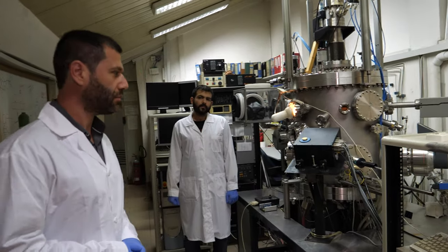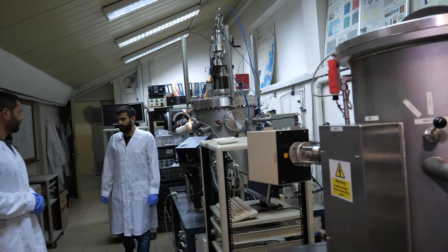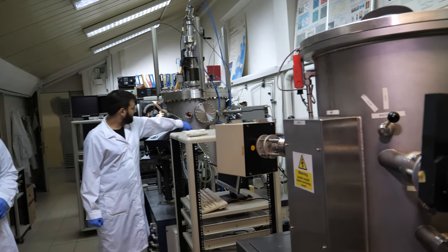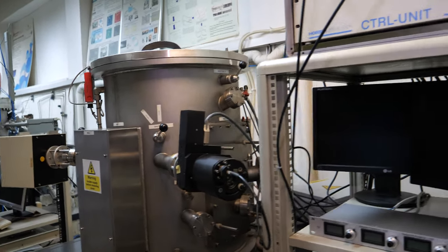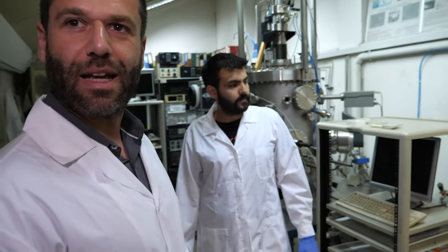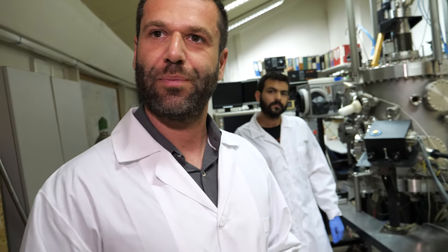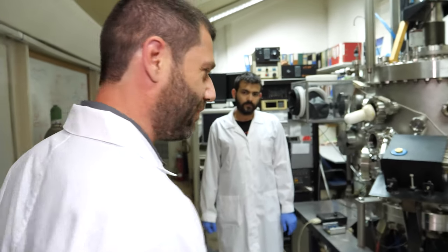This is also applicable to larger scale production. There is a similar machine here — it's not totally different, something similar. The main piece of equipment is the one we just described. On this tour we're going to be checking out a whole bunch of stuff, so let's go to another room.